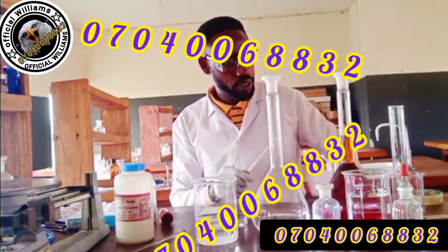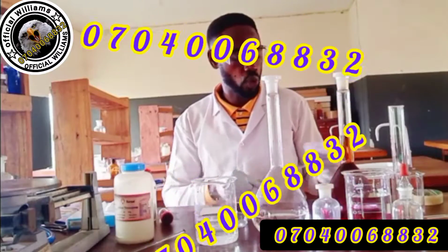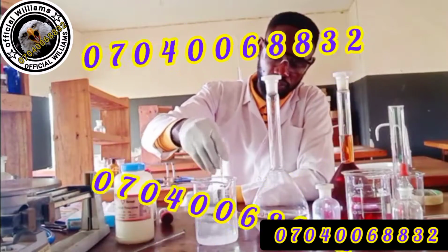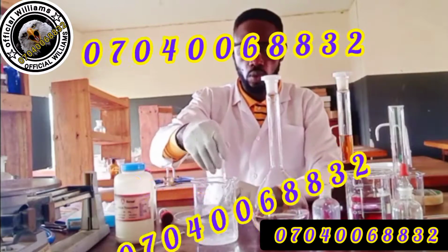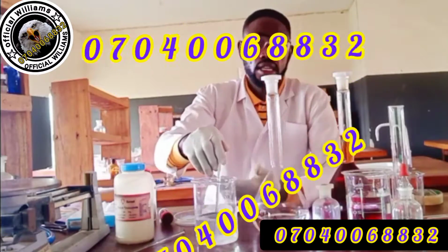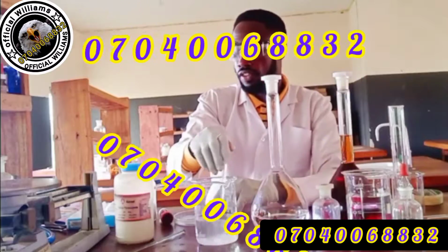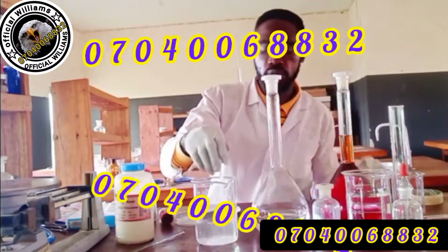Remember, you have to wash. I've washed all these things before starting every measurement. Wash well before any measurement. So I'll stir this. When it becomes completely dissolved, I will transfer here, then add up to 1000. The job is done. Correction, don't fill this to 1000 and add that 24.82. See, am I right? And add the 24.82, yes, of course.